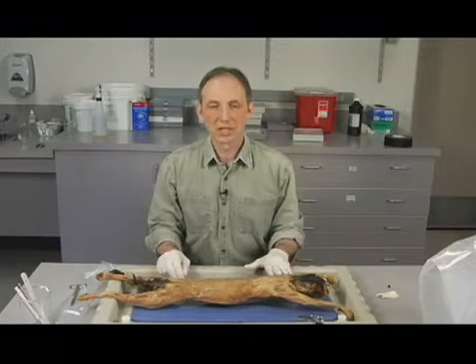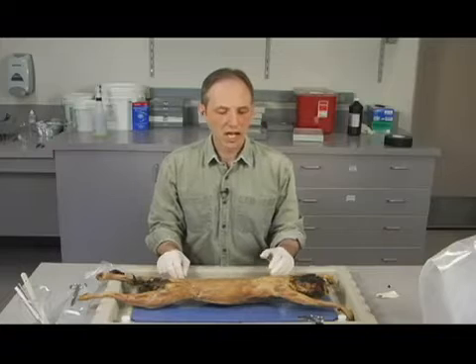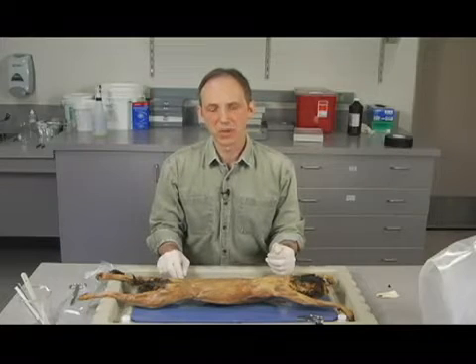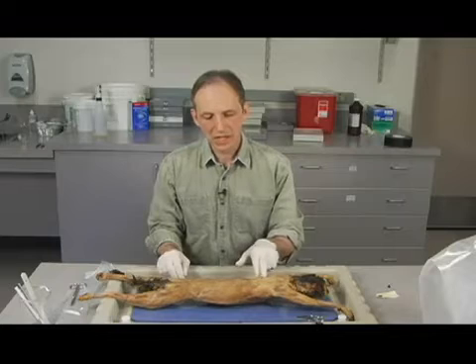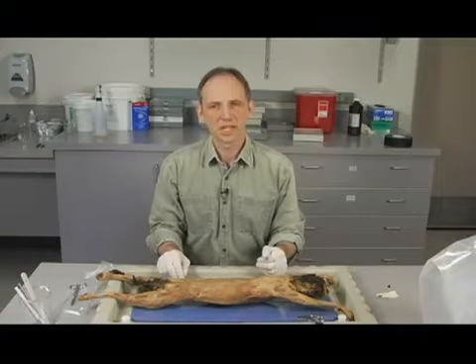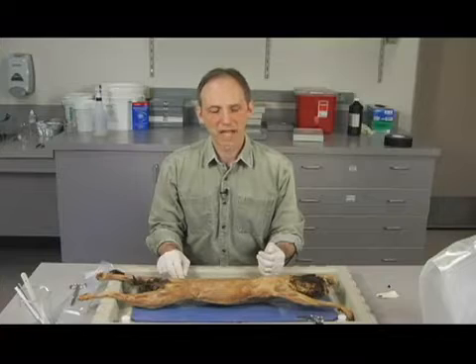What I'm going to be doing in a moment is using some of the implements. I'm going to demonstrate how we work on getting muscles of the cat exposed. I'm not sure how well you can see this, but there's fatty tissue around the cat, all over it. Underneath the skin, there's a tissue called fascia, and the fascia contains connective tissue, which includes some fat.